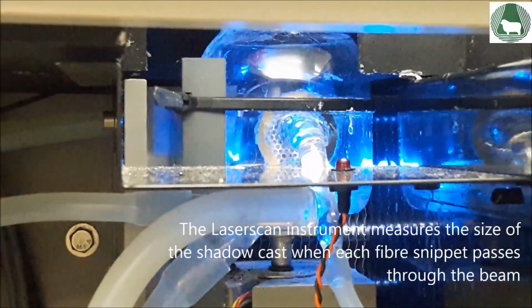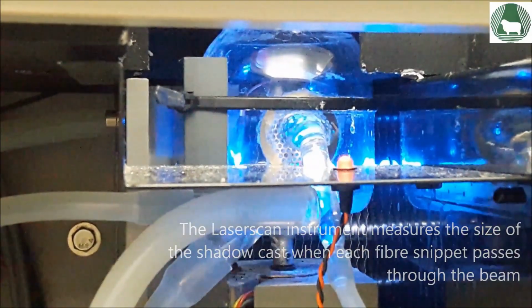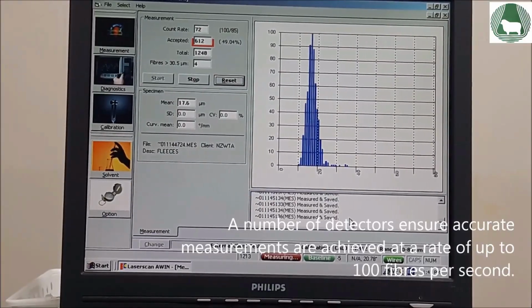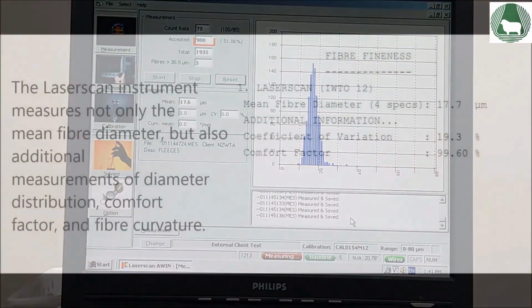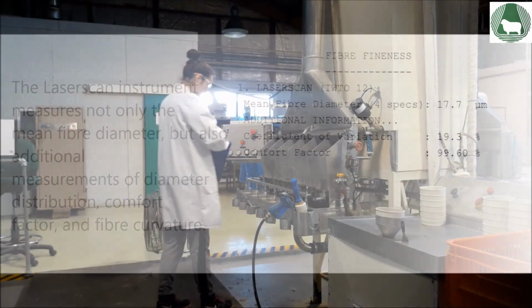The laser scan instrument measures the size of the shadow cast when each fibre snippet passes through the beam, while a number of detectors ensure accurate measurements are achieved at a rate of up to 100 fibres per second. The laser scan instrument measures not only the mean fibre diameter, but also additional measurements of diameter distribution, comfort factor, and fibre curvature.